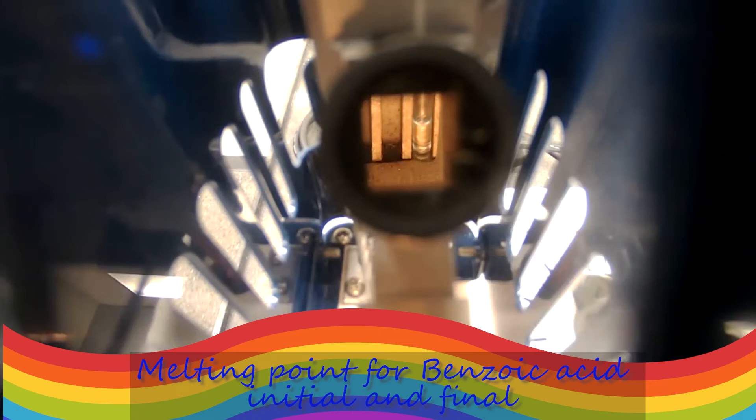Now this is the final melting for the benzoic acid at 120 and it is consistent with the other sample.